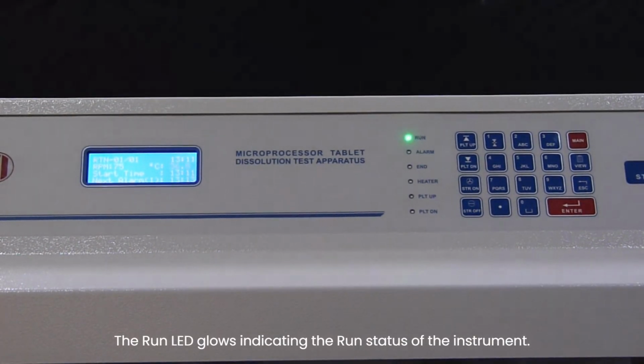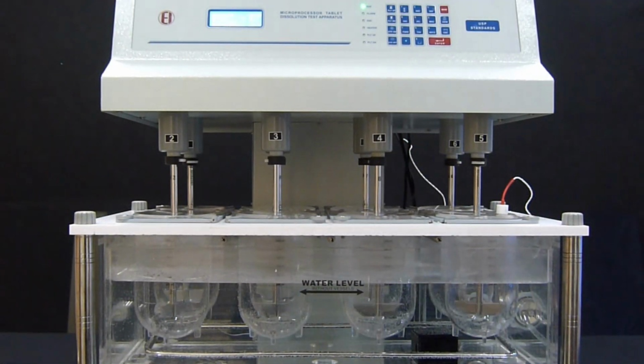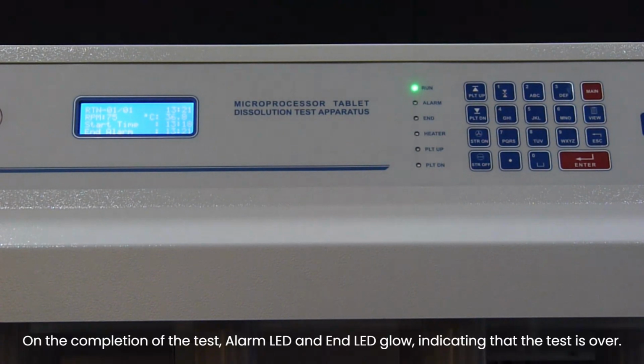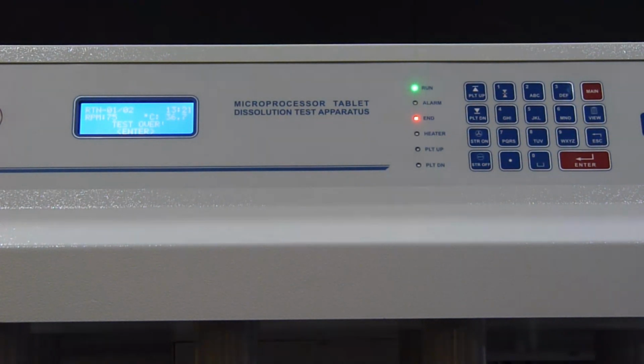The run LED glows indicating the run status of the instrument. On the completion of the test, alarm LED and end LED glow, indicating that the test is over. Press Enter key to return to the main menu.